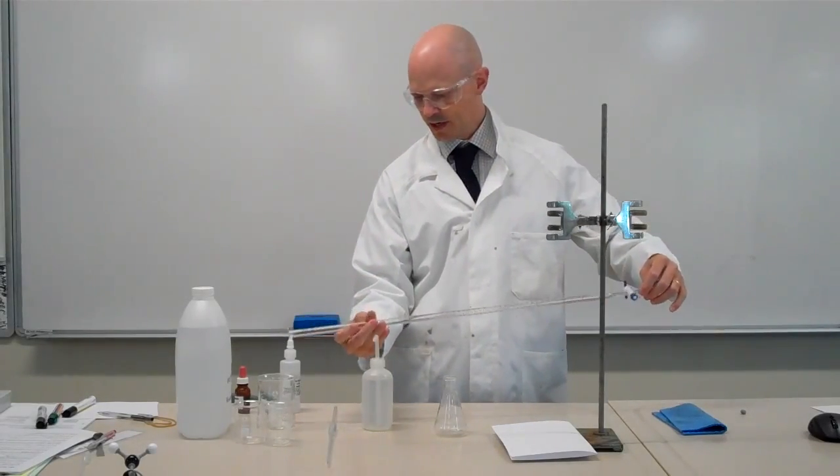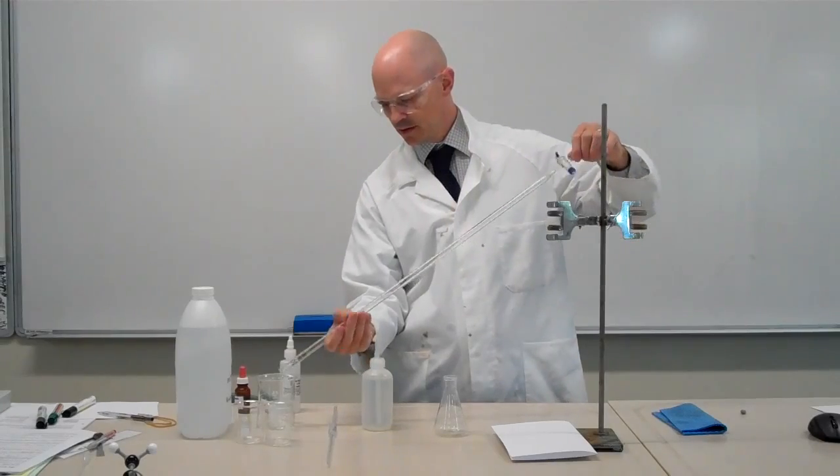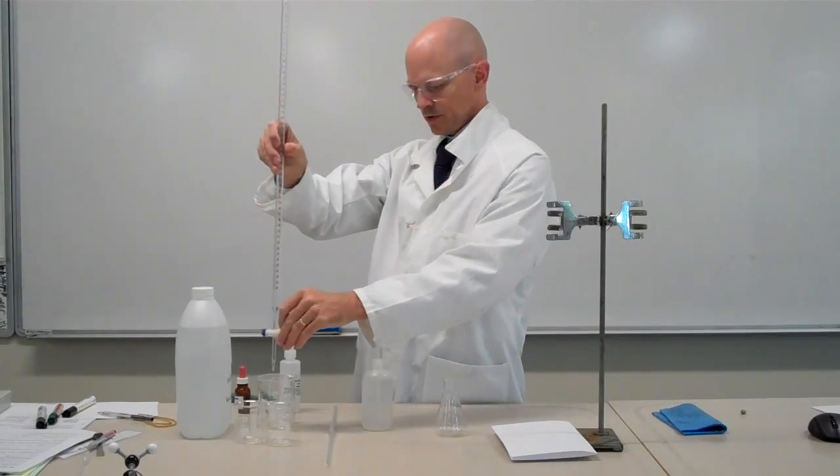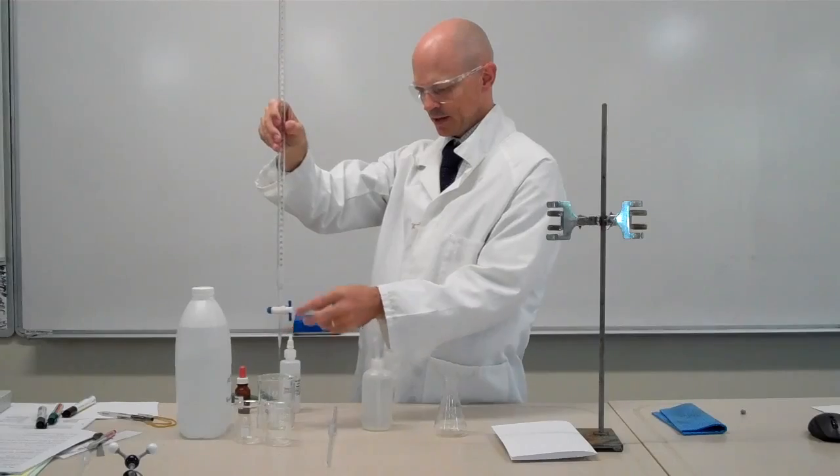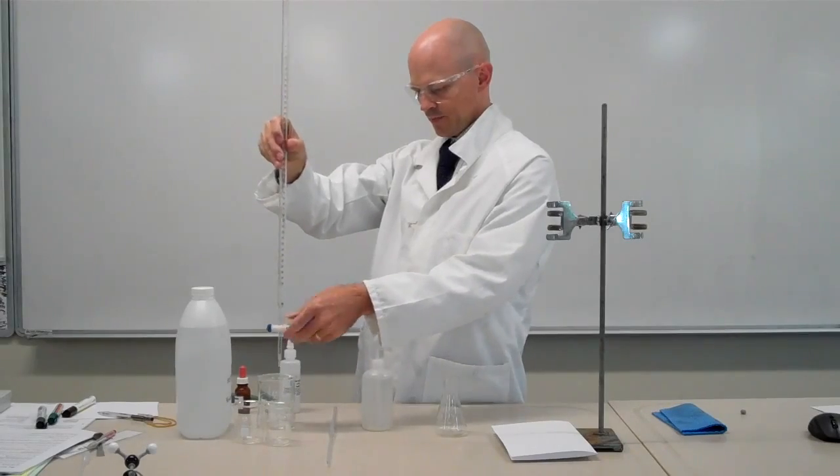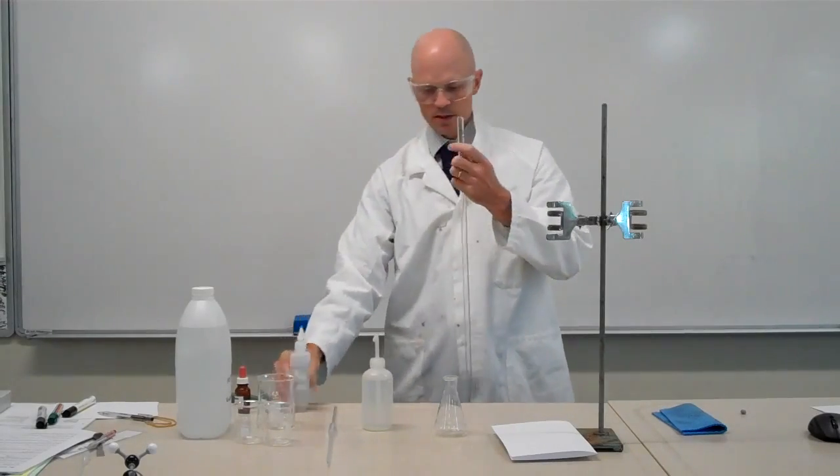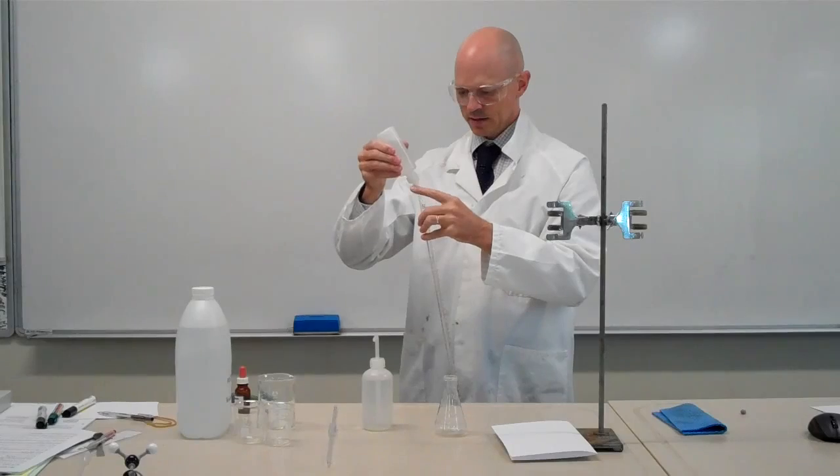And just wash out any other liquid that was in the burette to start with. I'm just draining out the tap as well. So the burette is washed with the chemical that is going to go in it.